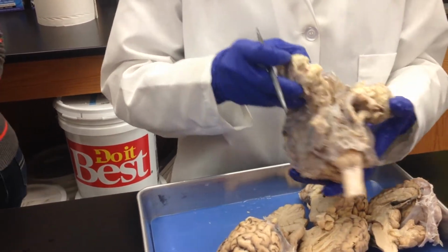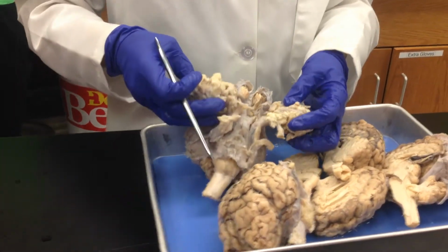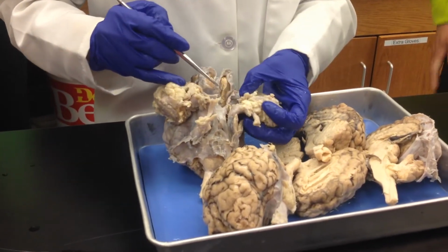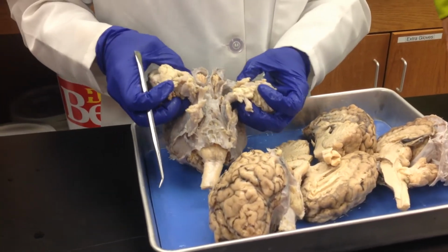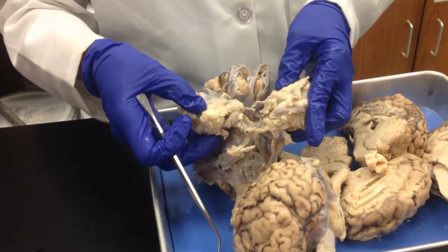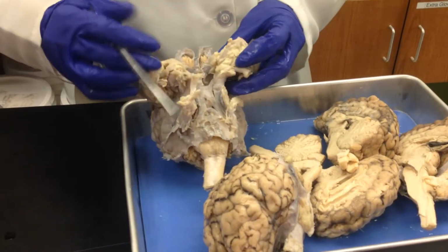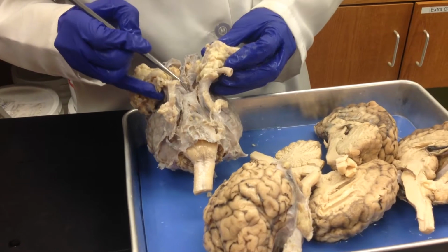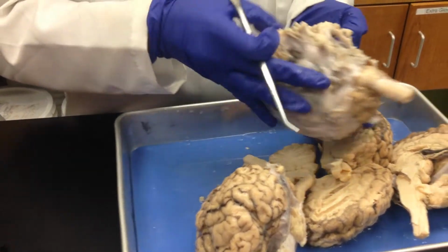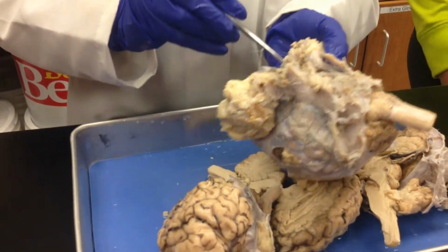And then these are where the eyes were. Okay? So each thing that comes out of here is your optic nerve. The optic nerve crosses, see right there, that's where it crossed. That's the optic chiasm right here. So it crosses the optic chiasm, and then from the optic chiasm on, it's called the optic tract. So past this will be the optic tract once it crosses over.